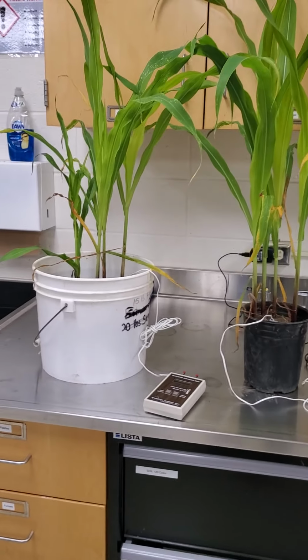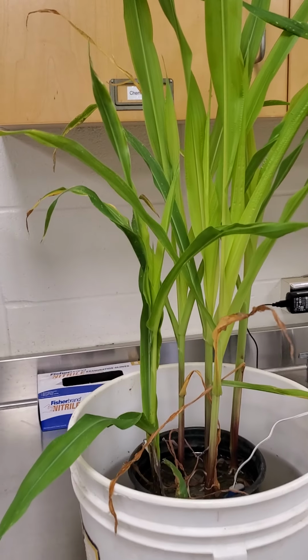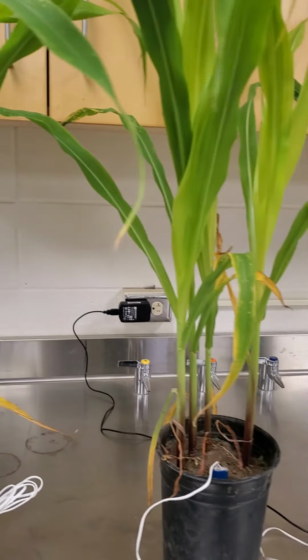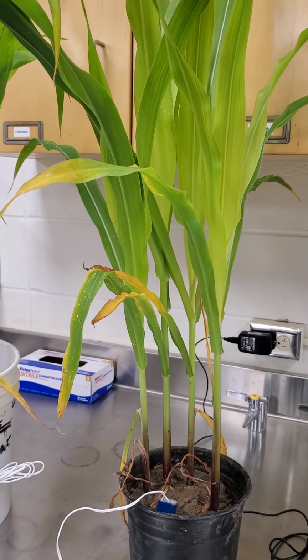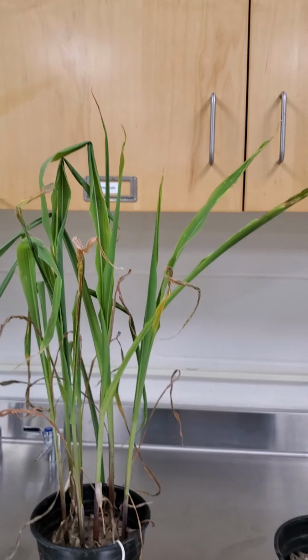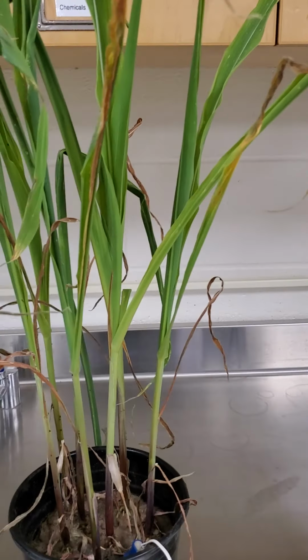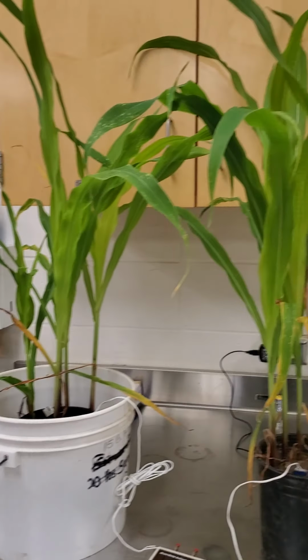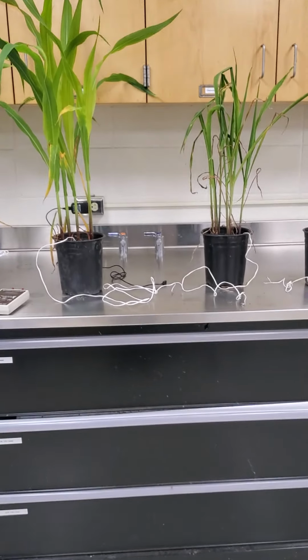The next thing that we look at is plant condition. What do the plants look like, just condition-wise? Is it pretty good? Do they look pretty healthy? Is there any wilting or any other things that would indicate stress? So the first 2, maybe not so much, but the second 2, the 2 drier ones, definitely have a lot of curling, wilting, signs of necrosis, death. The other 2 look relatively healthy, maybe a little bit of yellowing, but other than that, pretty healthy. So that's the second thing.